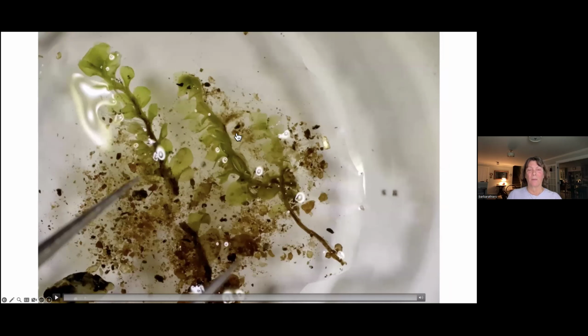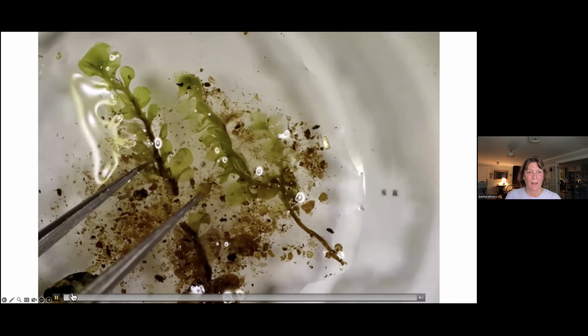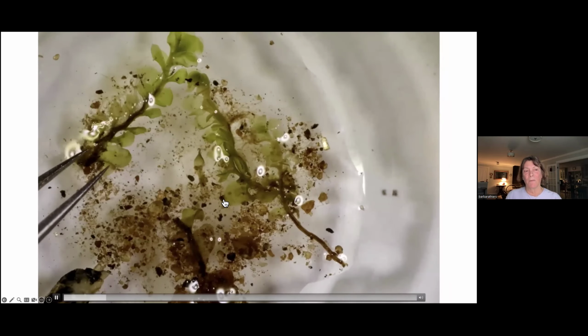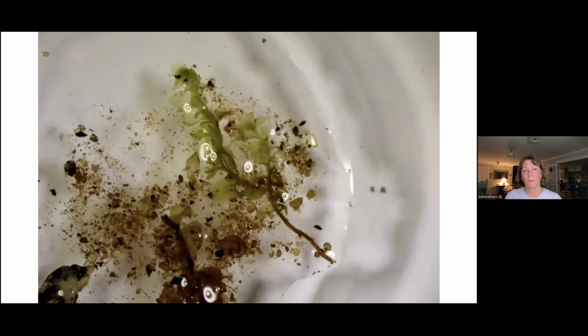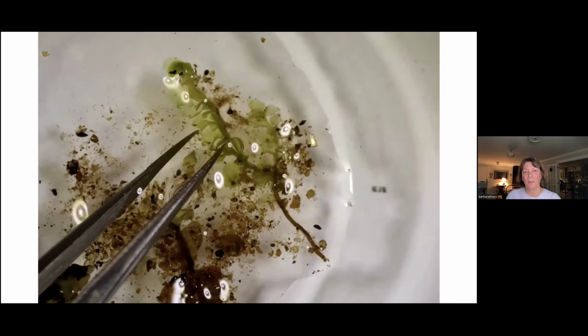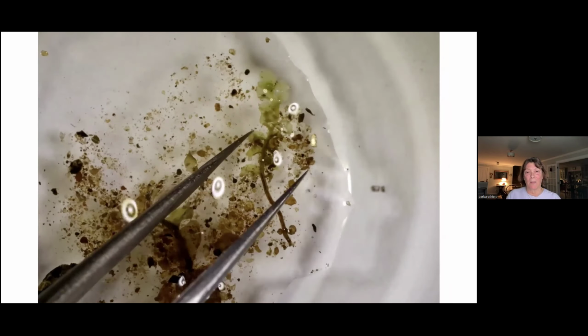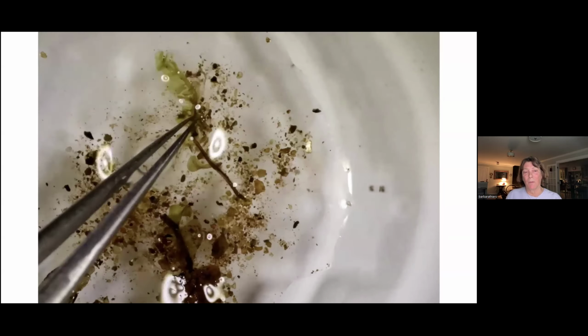And then I'll collect some stems in one of the wells of my depression slide. And of course, I've managed to bring a whole lot of dirt over. So the first wash in the depression slide is to get rid of a lot of that grit. I usually have more stems than this that are candidates for various things I want to do. Use some to look at leaves, some to maybe make a cross section of a stem, others to maybe mount whole, if that seems like the thing to do, depending on what it is.